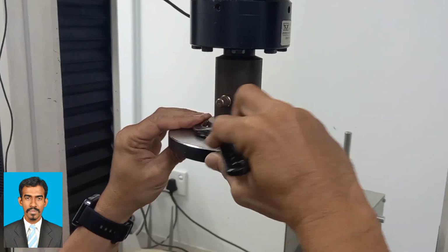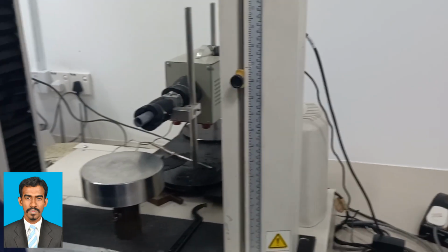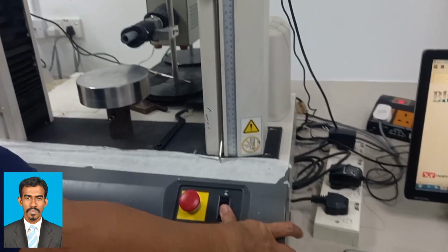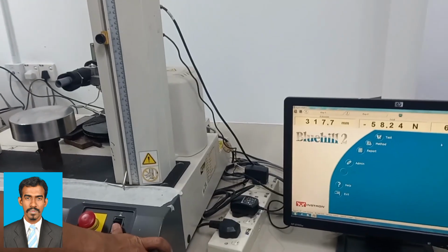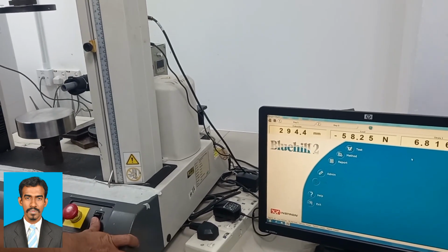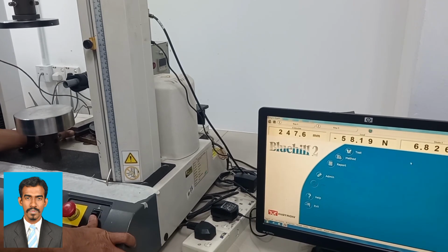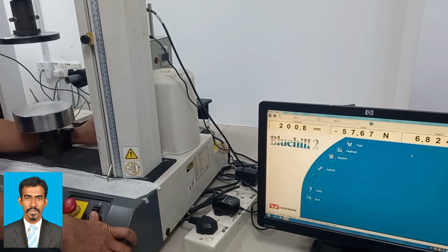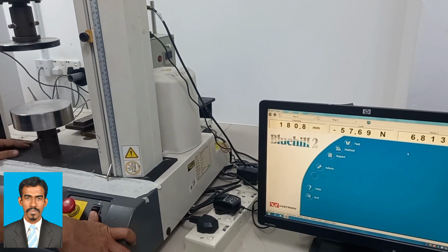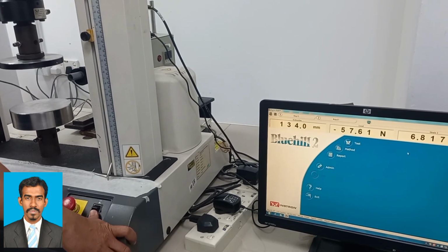The test sample form is usually a cube, prism, or cylinder that is compressed between compression plates. The force is measured by the load cell and data gathered by the test controller. In these applications, the machine's platen-to-platen displacement is measured using the crosshead motion position encoder. Some materials fracture at their compressive strength limit, others deform irreversibly. So, a deformation limit may be considered as the limit for compressive load.